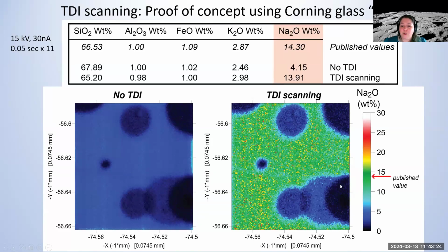In addition, the nice thing is, as you can see, this is supposed to be a standard. What you can see there are all these round spots, partially overlapping. I should show you a backscatter image with it. You can't see previous analysis spots. That's the other devilish thing with this material. Specifically for something that was analyzed before, you can't always see the beam damage just by looking at the backscatter or secondary.